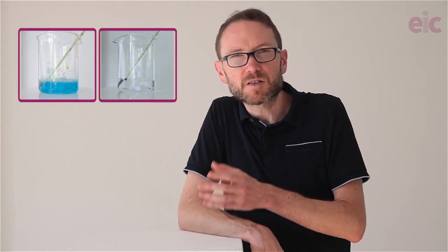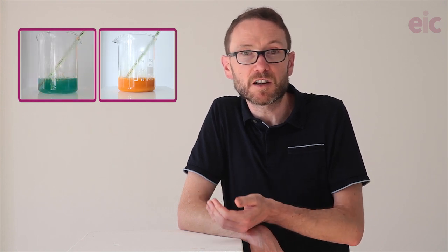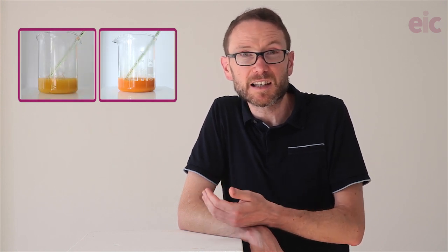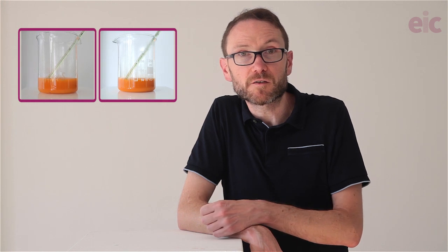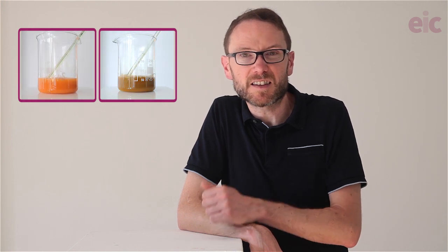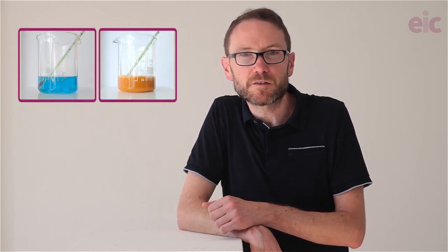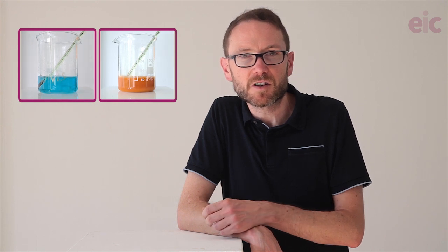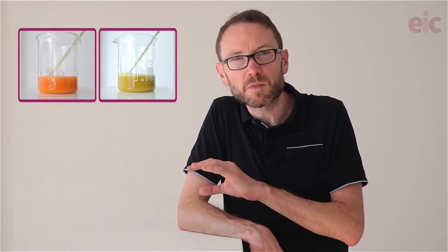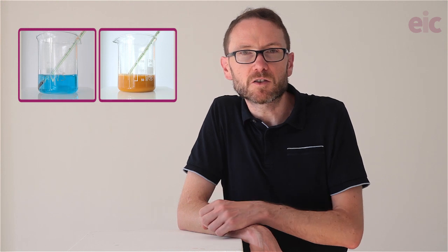Using 0.5 molar as opposed to one molar copper sulfate means that you don't need to measure volumes less than a millilitre, as you might find with other variations at this scale. The copper sulfate solution does strongly affect the colour and speed of the demonstration, so working with 1 ml of 0.5 molar felt like a good compromise.